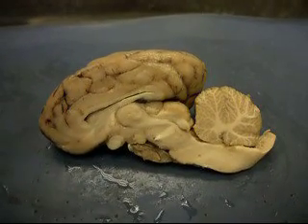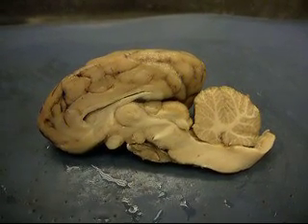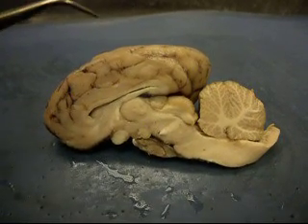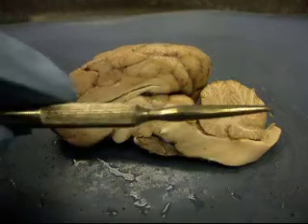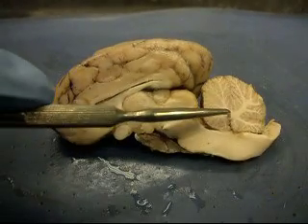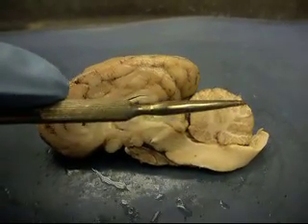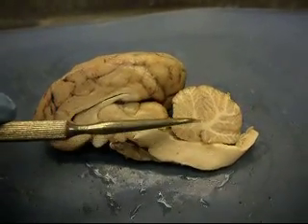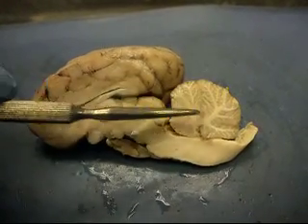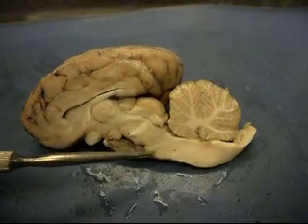This is a demonstration of the sheep brain. First, let's talk about the cerebellum and arborvitae. This whole thing is the cerebellum, and this is the pons right here.